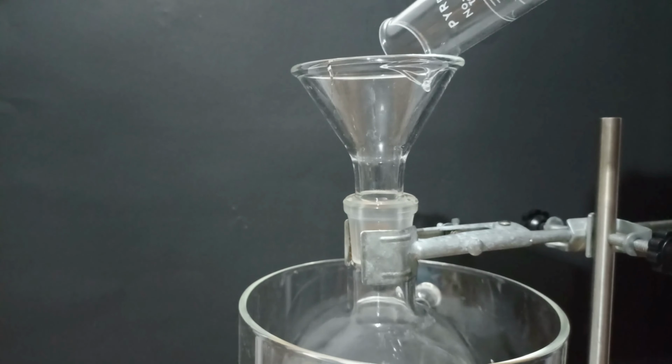But watch out, please do not fill the round bottom flask as much as I did, because this could happen. After adjusting the temperature, I got a nice and gentle boil. I kept the reflux for 1 hour and then let it cool.